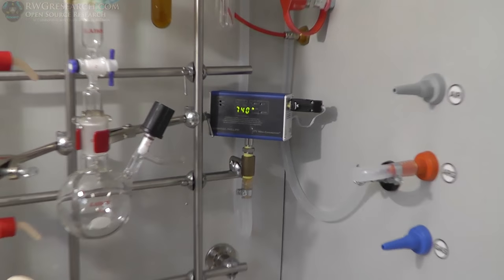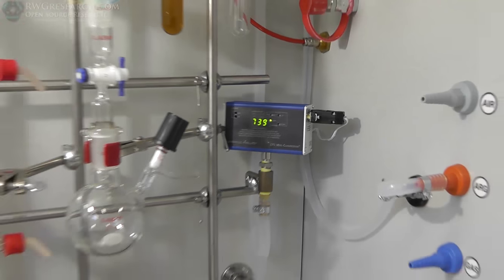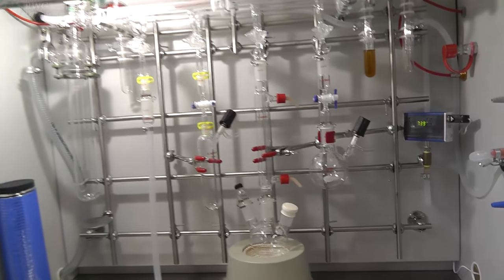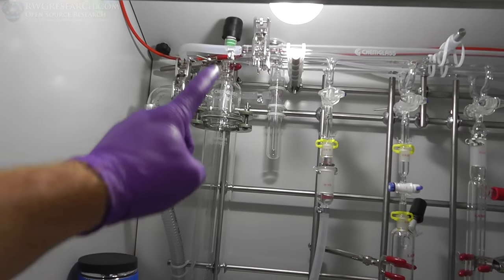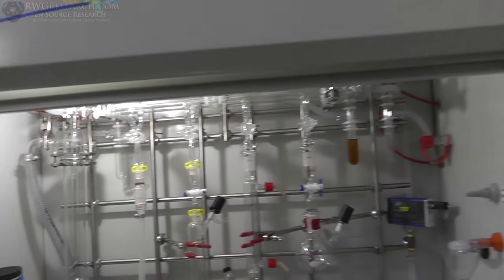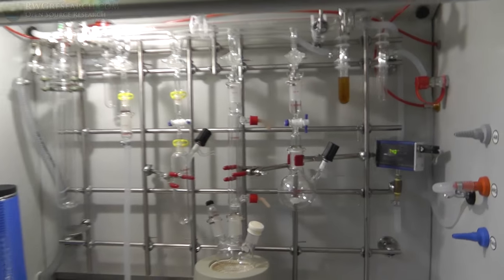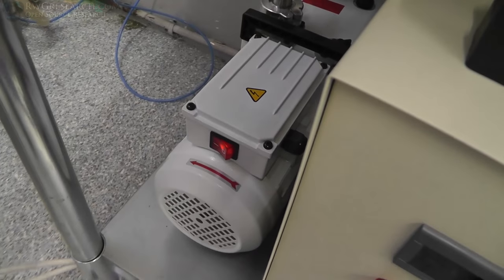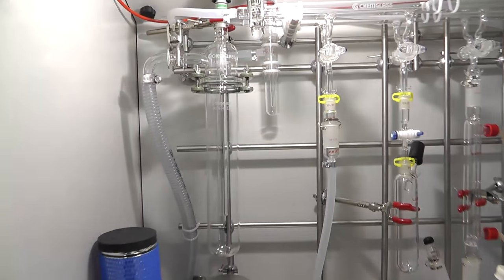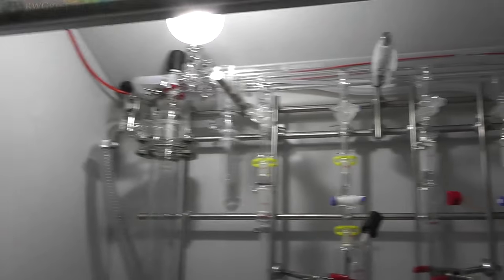I guess it's time to turn this thing on and test it. Here is the current vacuum gauge, all connected, set up and ready to go. So I think what we're going to do right now is turn the vacuum pump on and open up the valve right there and just see if this thing holds a vacuum, see what we can get the vacuum down to. So let's set up for that. I have closed that valve and I think we're ready. Let's see what happens. Hopefully nothing explodes. Got my safety glasses on if it does.